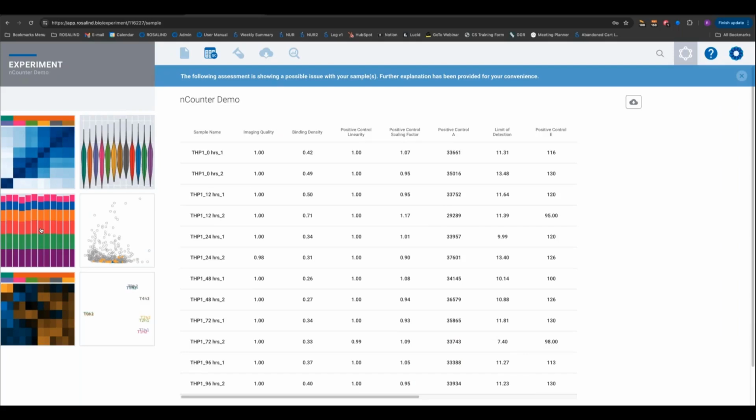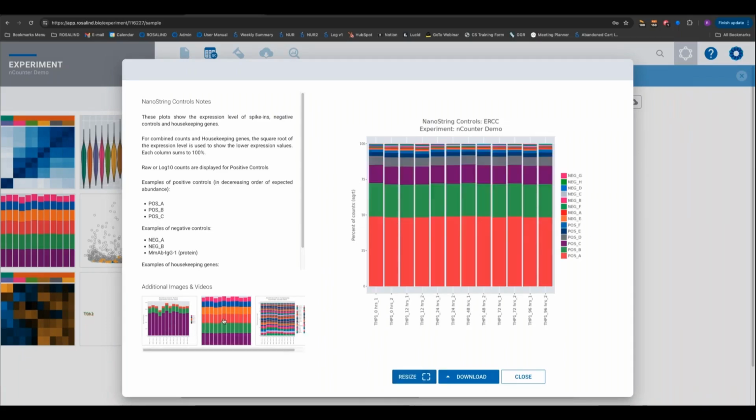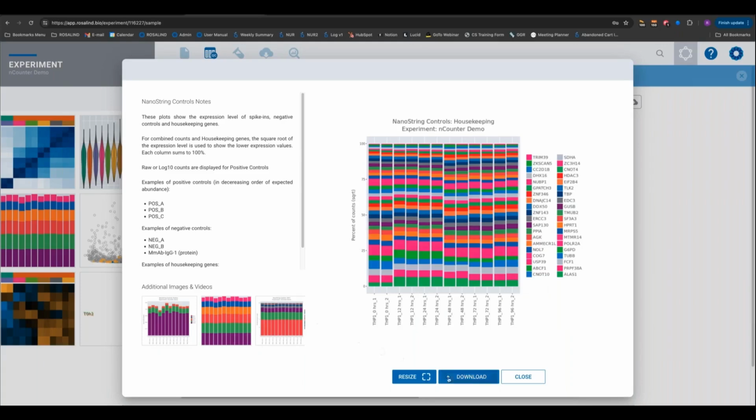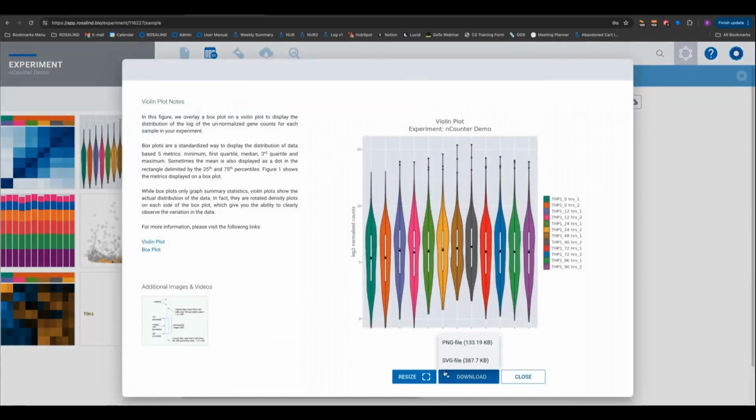We have visualizations for all of these positive and negative controls and housekeepers that I just talked about in the slides. So you can look at what is the expression of the positive controls. We have a view of the stacked percentage graph for the positive controls and negative controls. We have plots for housekeeping genes as well. And I will point out that you can download these as well. So you'll see there's these download buttons. You can download SVGs or PNGs. In some cases, you can also download the CSVs to get the data behind the plots.